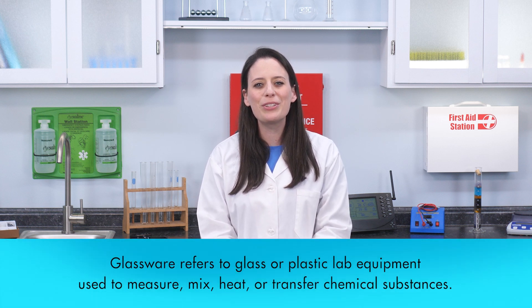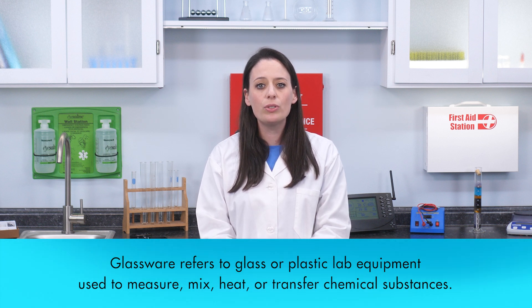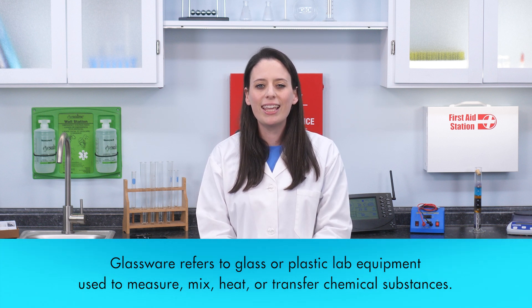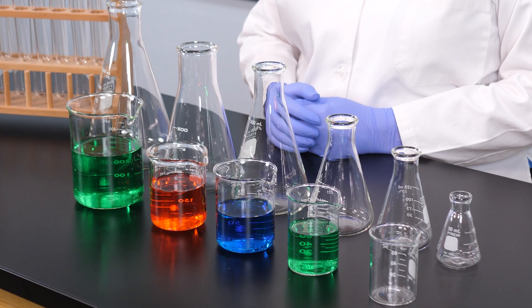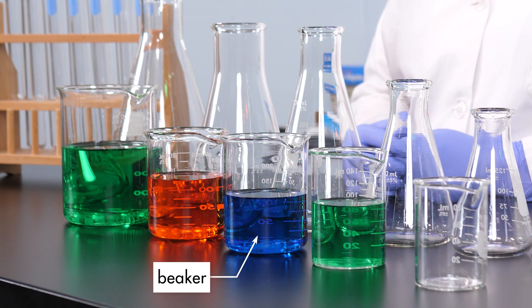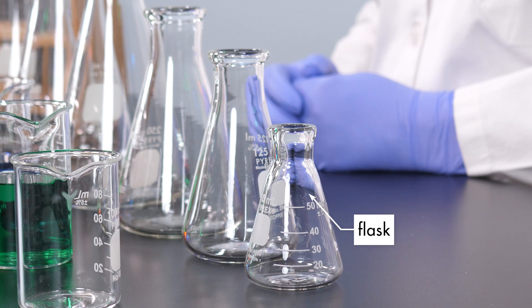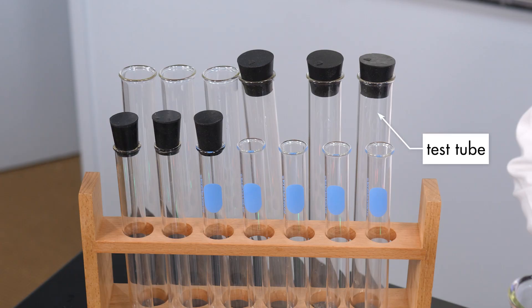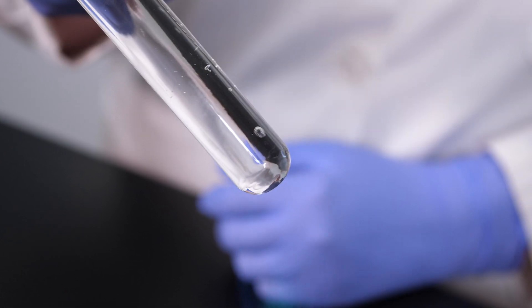Next, we will discuss some basic glassware. Glassware refers to glass or plastic lab equipment used to measure, mix, heat, or transfer chemical substances. Some common glassware includes beakers, flasks, and test tubes used to hold, mix, or heat chemical substances.